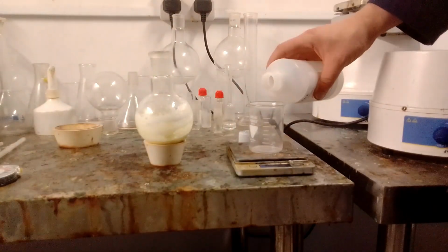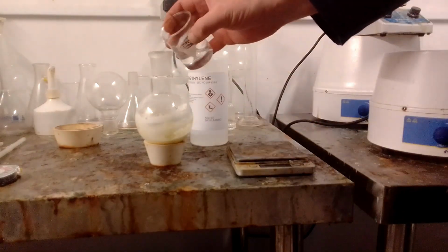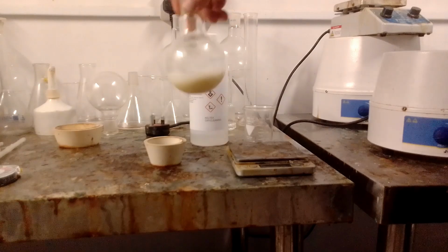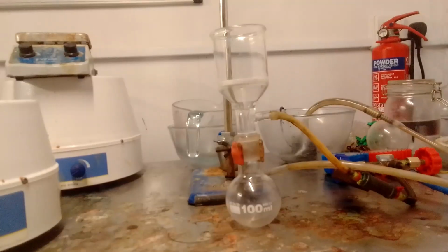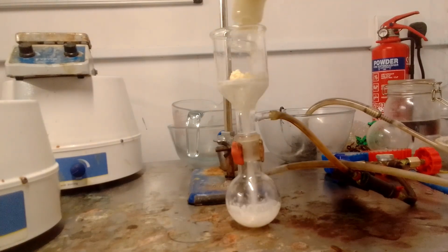The marshmallow-like solid mass that remained was mixed with perchloroethylene and shaken thoroughly. The extract was filtered by vacuum twice and cooled overnight in the fridge. In this case, the product itself can't easily be isolated, as it has a tendency to react with itself and polymerise when the solvent is removed, resulting in tar.